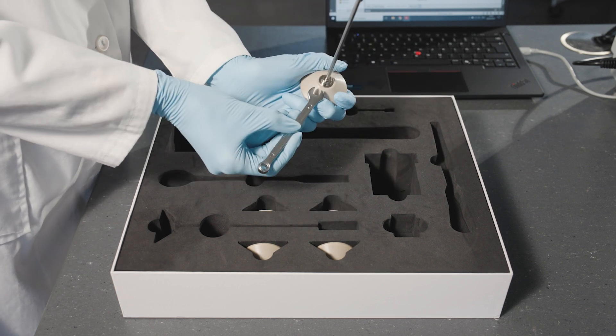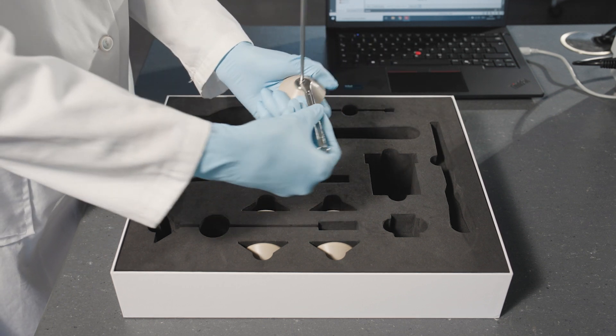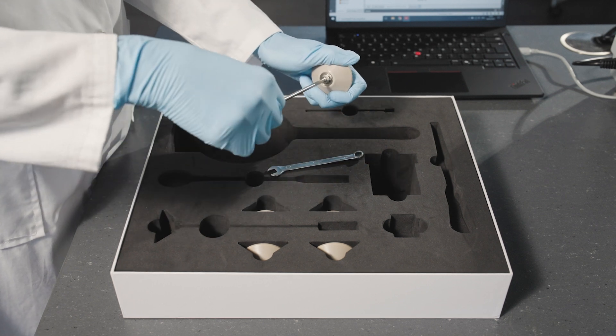Replace the compression disc of the measuring system.